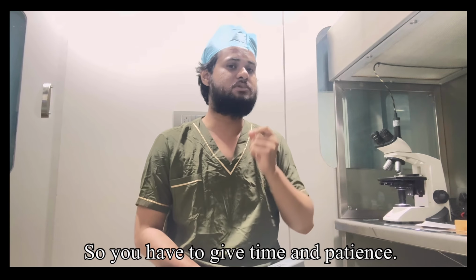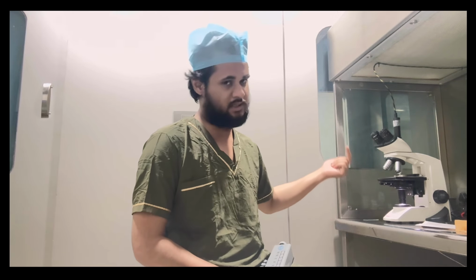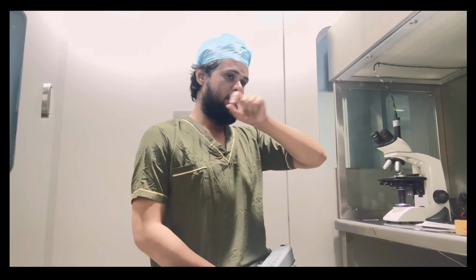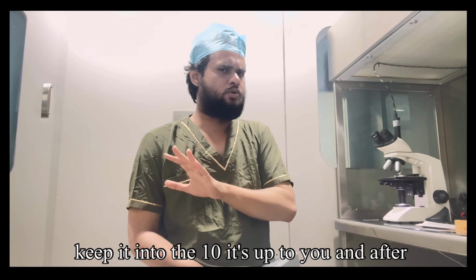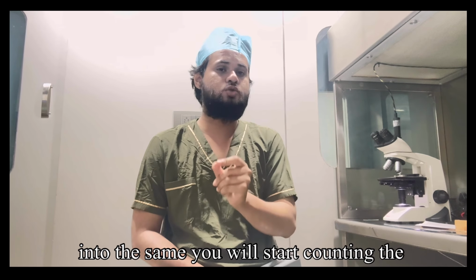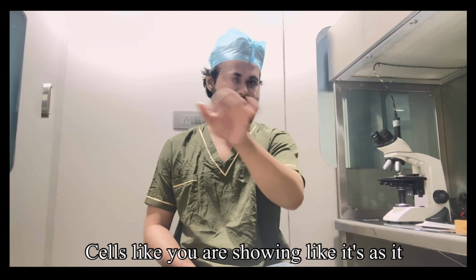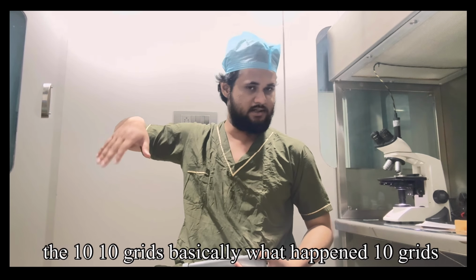So you have to give time and patience. After focusing with the minimized lens like 10x, you will shift to the 20x, or you can also keep it at 10x, it's up to you. Then you will start counting the cells, as it's visible on the screen, where you are seeing 10 grids.